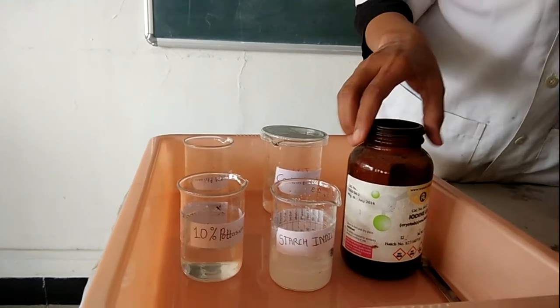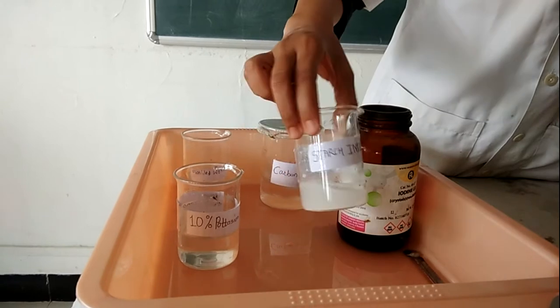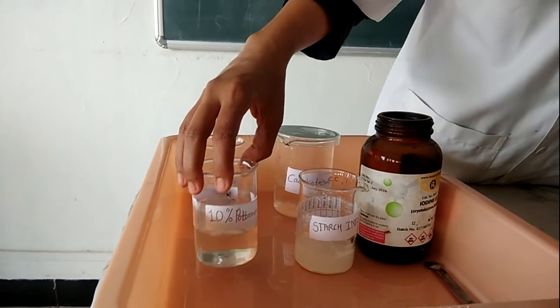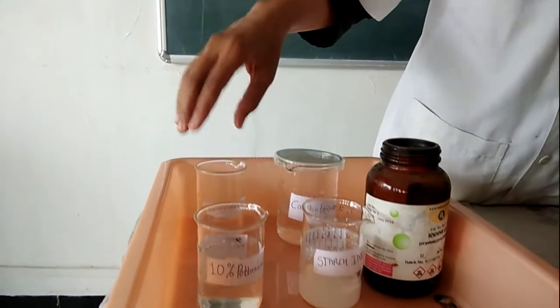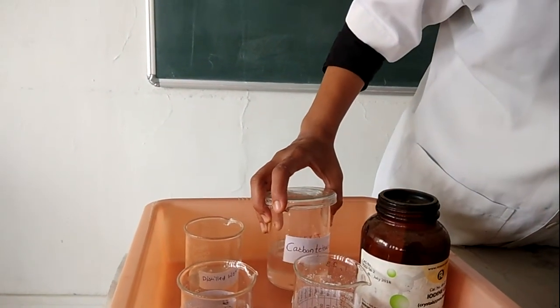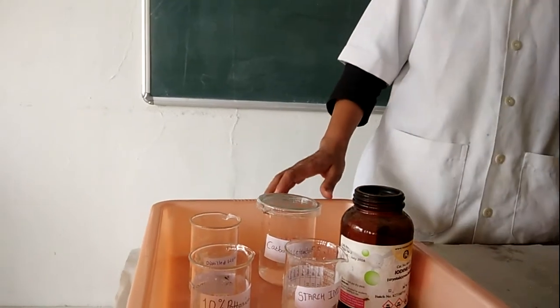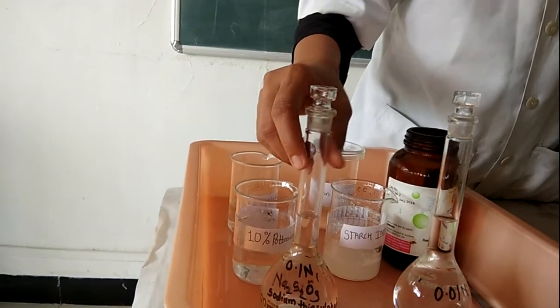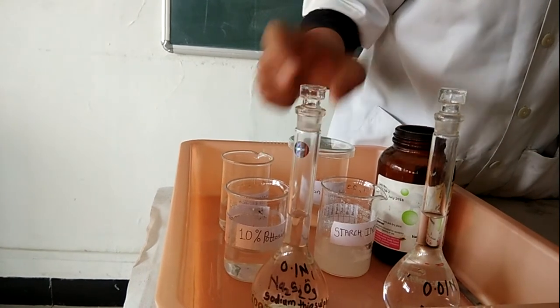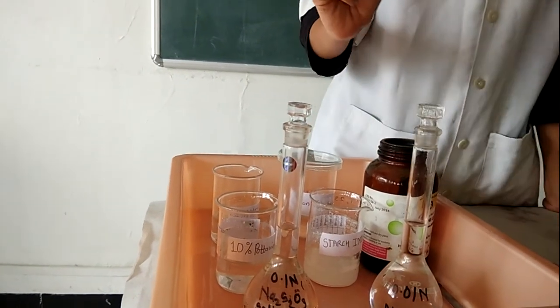The chemicals required to perform this experiment are: iodine, starch indicator, 10% potassium iodide, distilled water, carbon tetrachloride, 0.1 normal sodium thiosulphate, and 0.01 normal sodium thiosulphate.